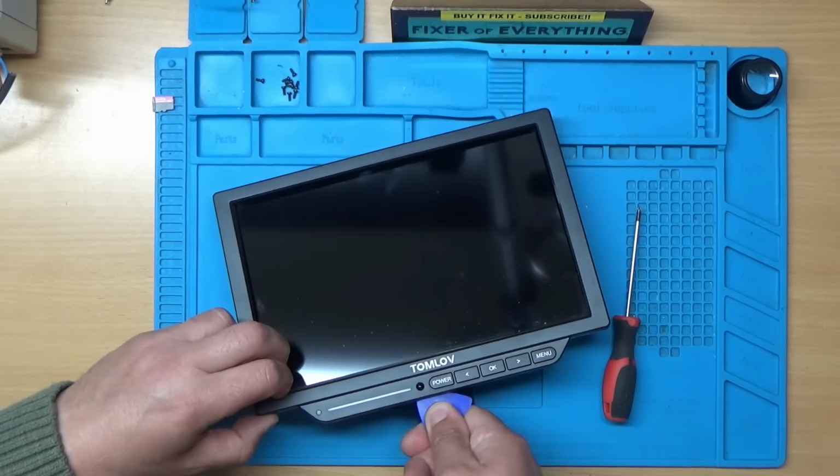This is the built-in illuminator, but I use an external one. Right, so we've got a little connector here. Let's just pop that out. Get this front bezel out of the way. And that's the LCD screen. So I'll just unplug that as well, get that out of the way. And this is the main board here.